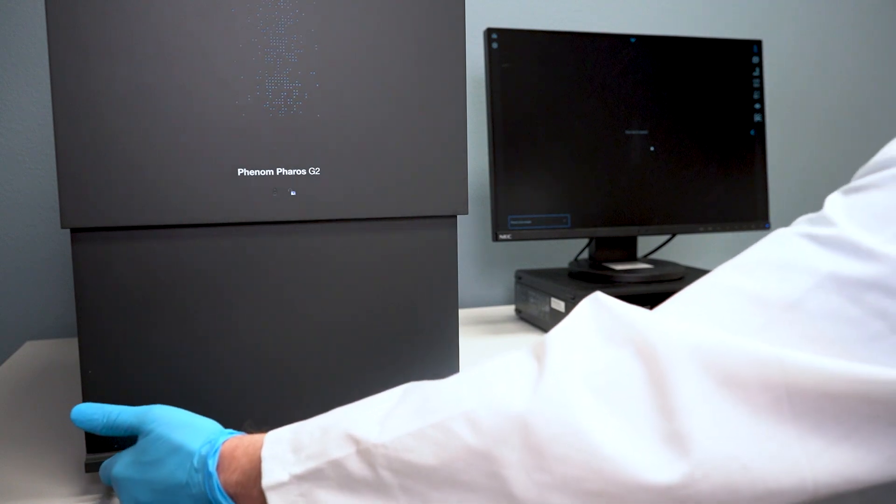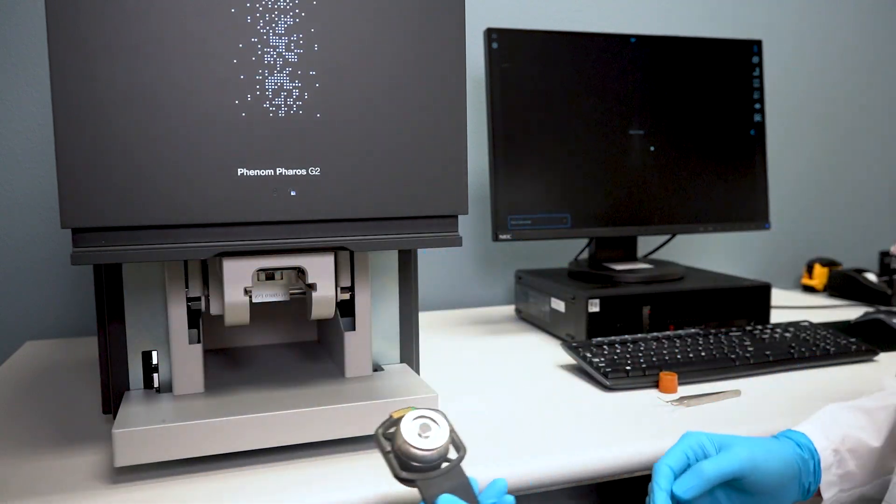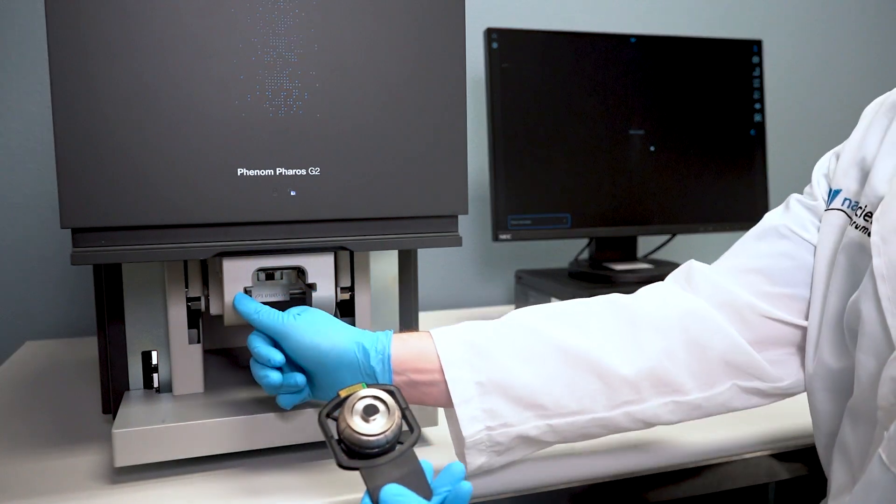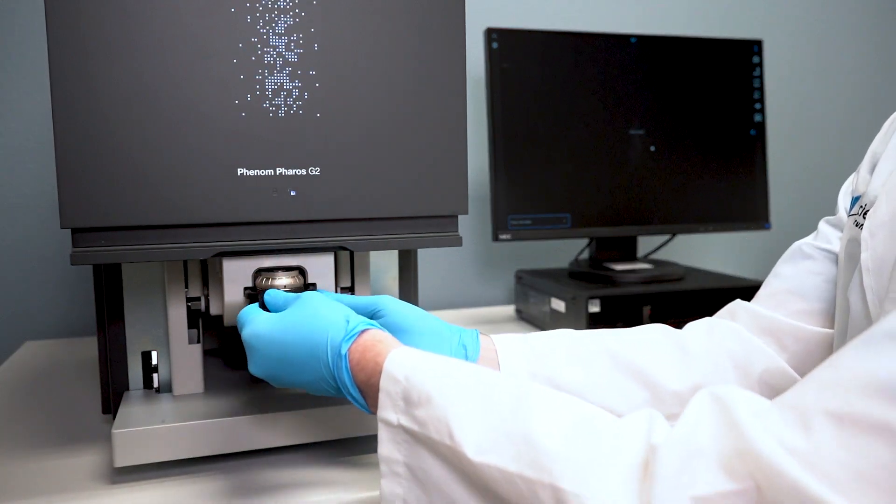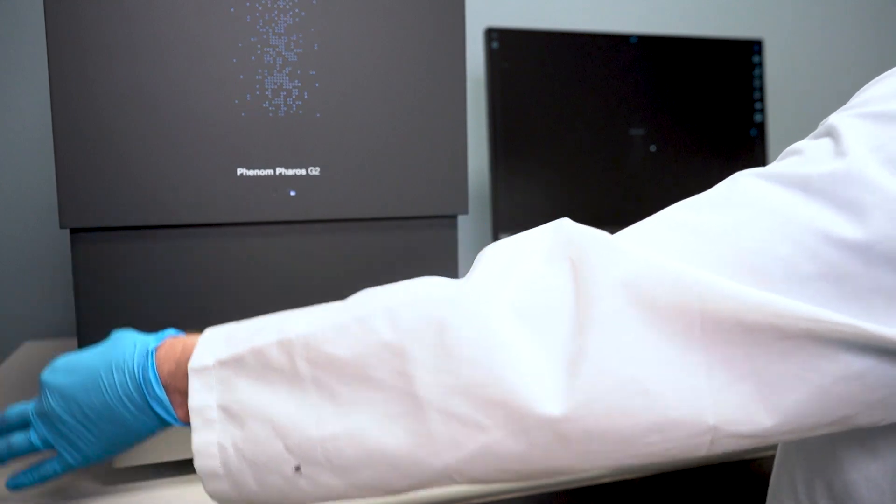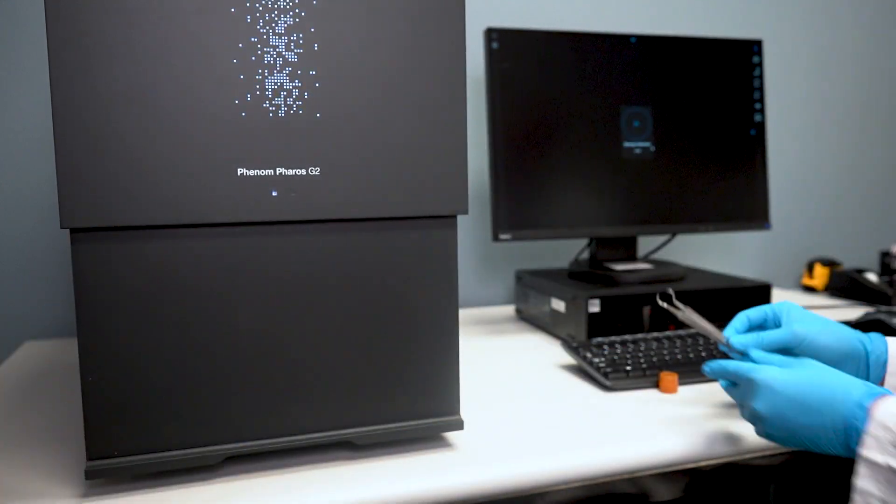I slide the door up and open and align the sample cup with the notches inside the SEM and then push the sample cup in until it stops. Then using two hands I slide the door closed.